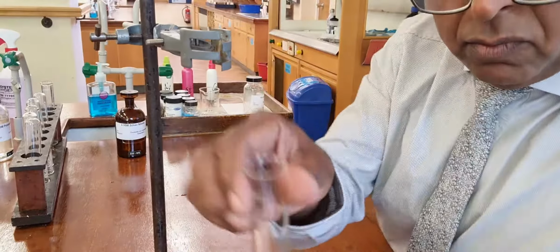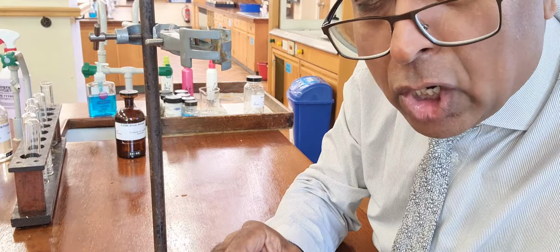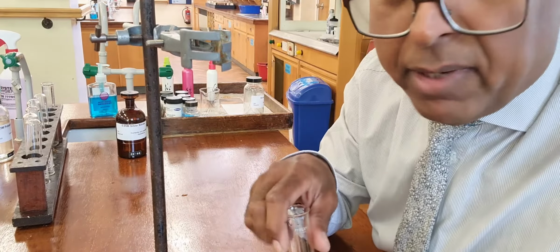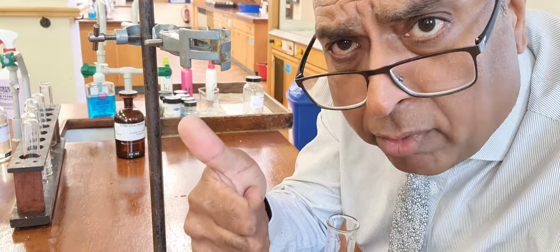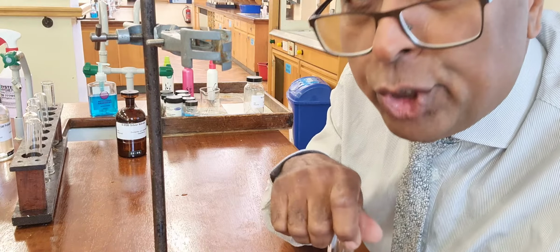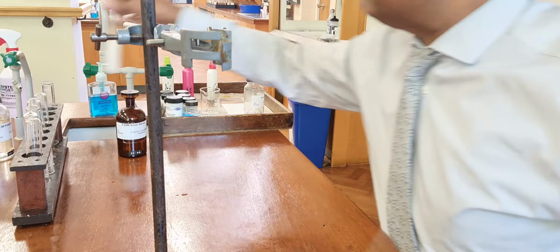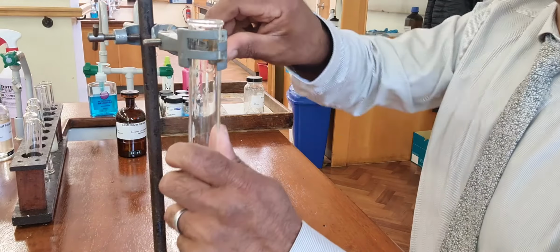So, acid and barium chloride we use this time. Barium chloride, but barium nitrate is fine. Anything with barium ions in, barium chloride, barium nitrate, both have barium ions in, and therefore we can use either in testing for sulfate like that. Next one.